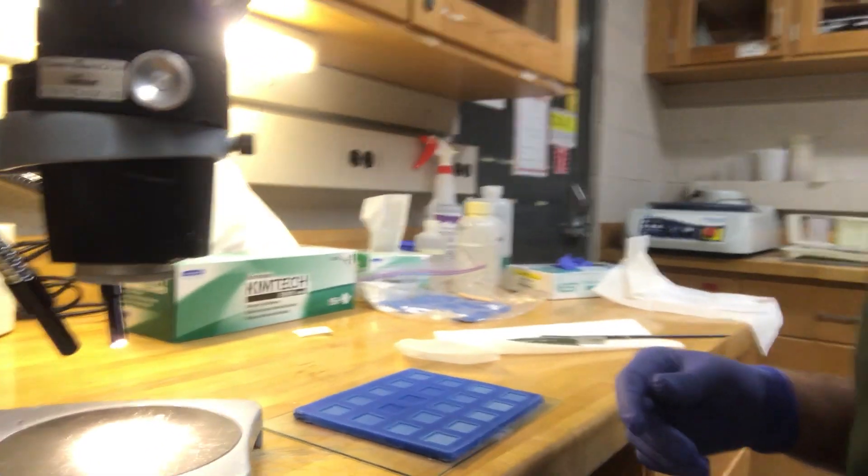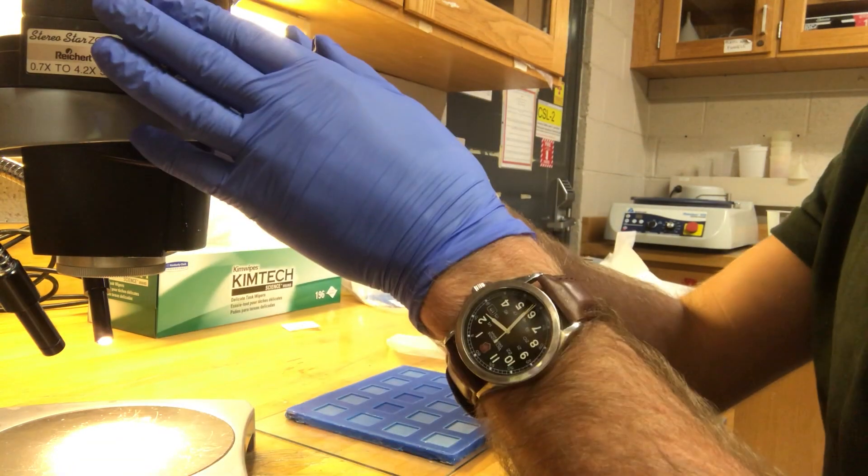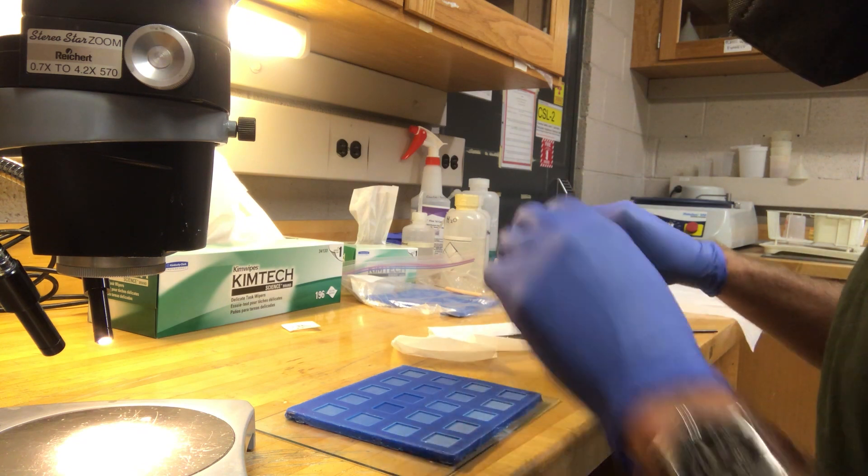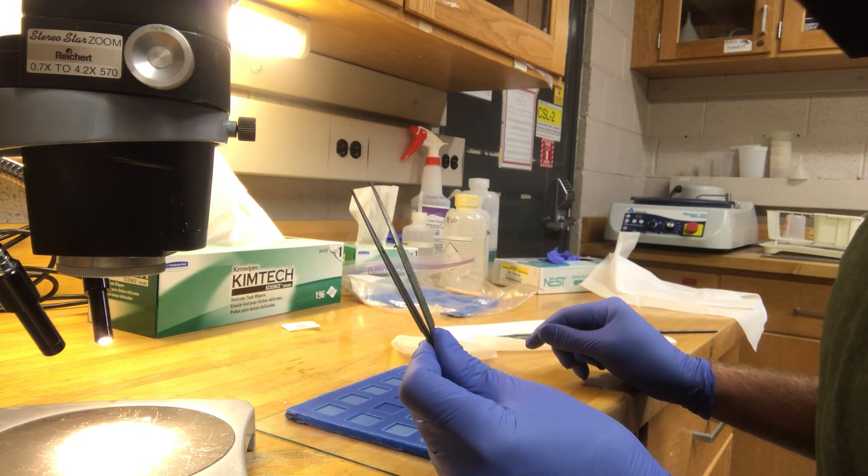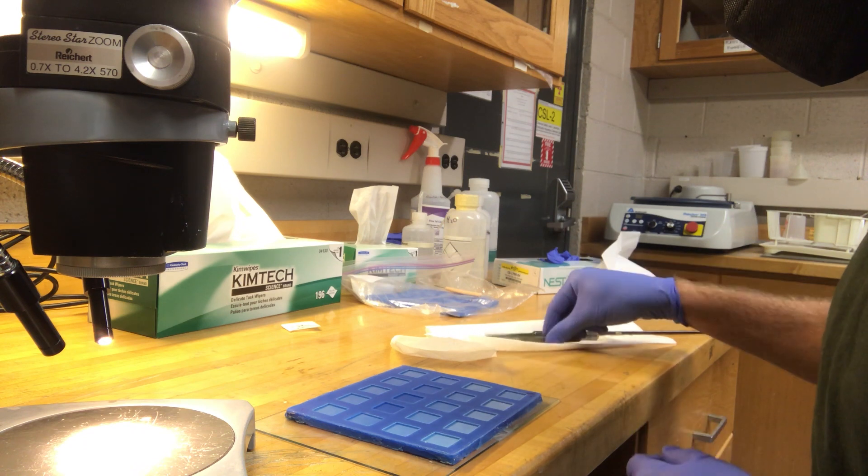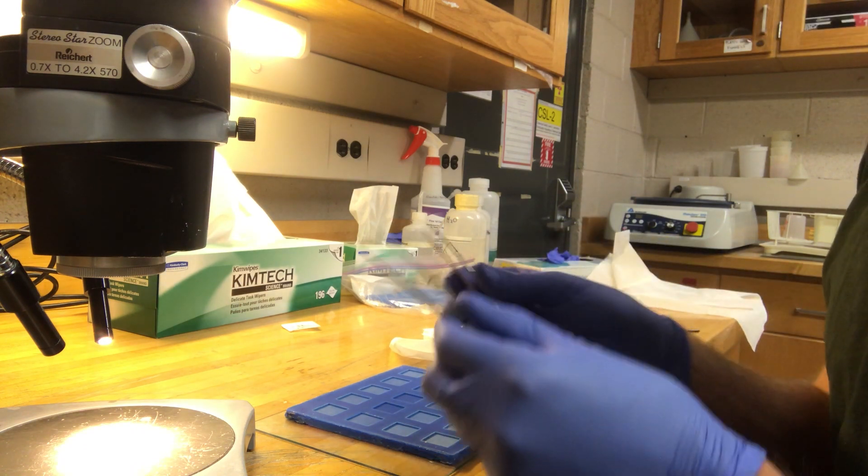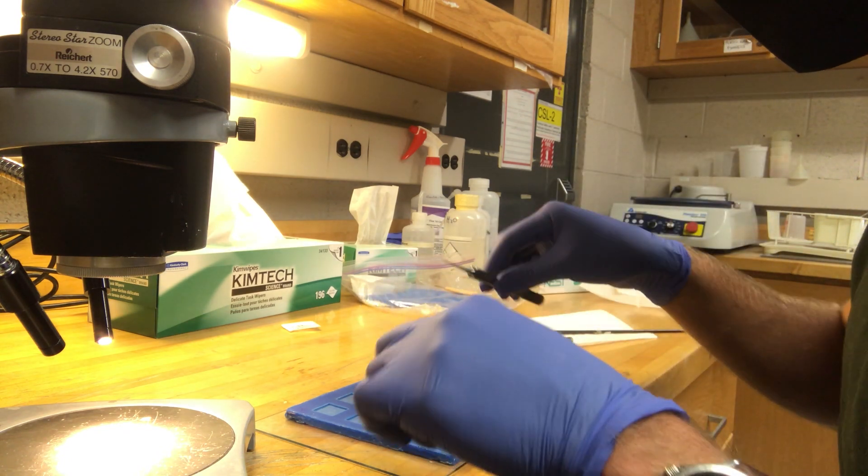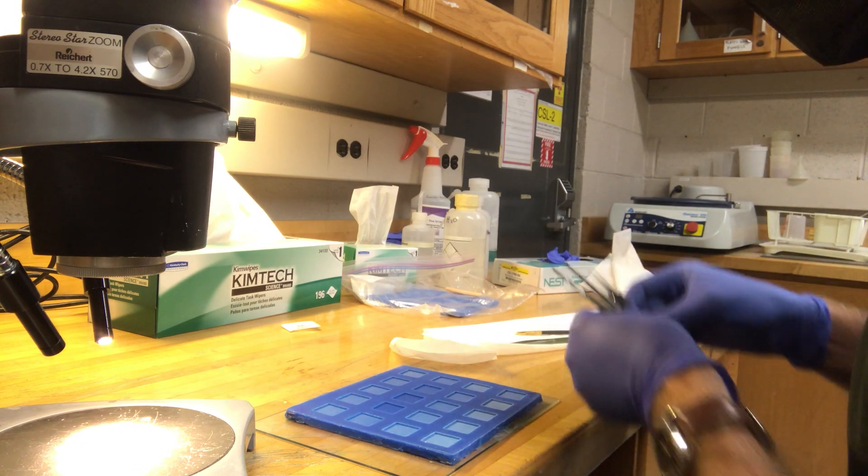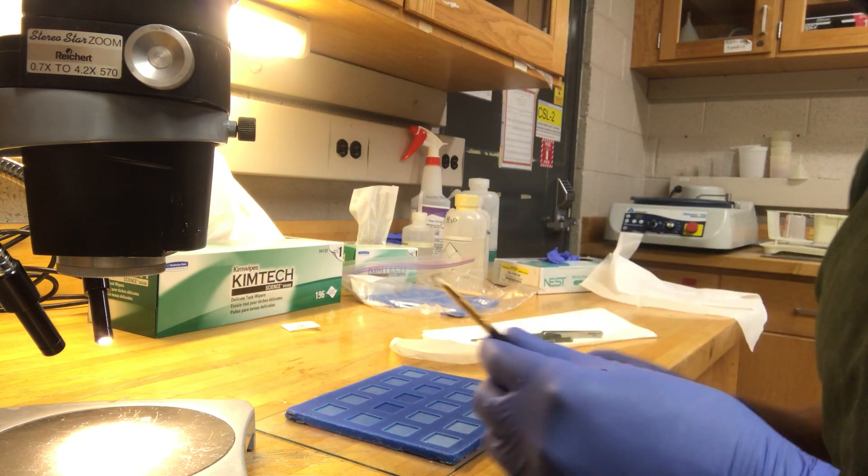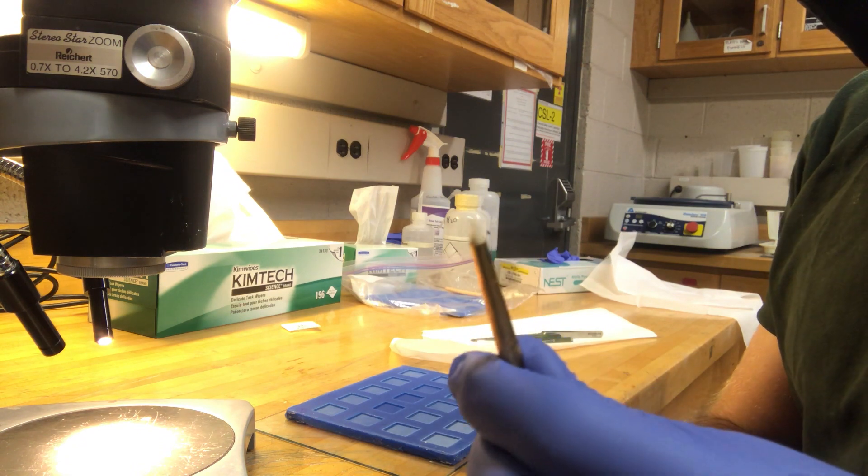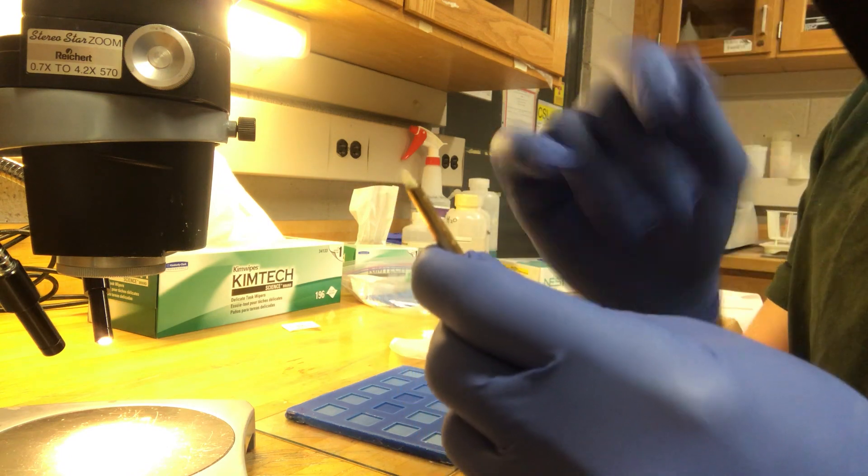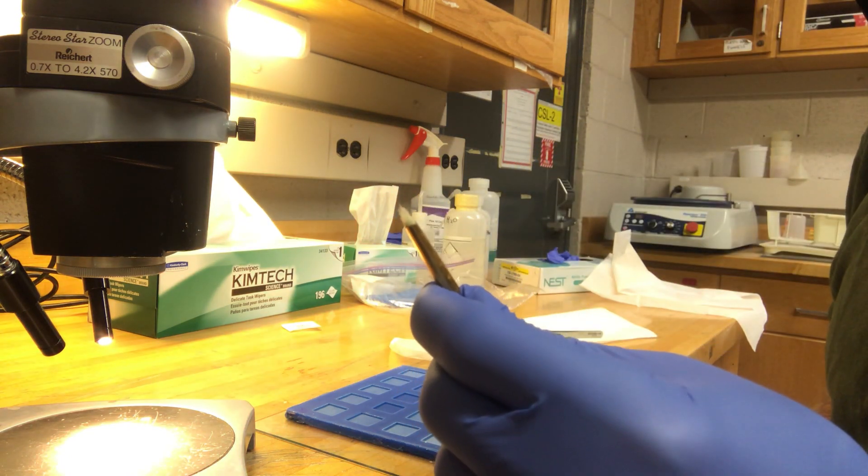What we need to set up is a microscope, a little optical microscope to check how our samples look. We've got several pairs of tweezers, mostly to hold down the paper and make sure we cover the various molds while we pour. We also want a little thick bristle paintbrush like this one where it's got a lot of thick little bristles so the apatite grains can't get stuck to it.